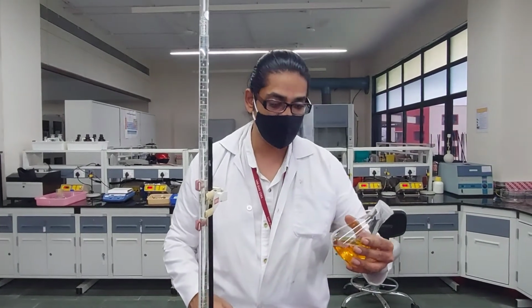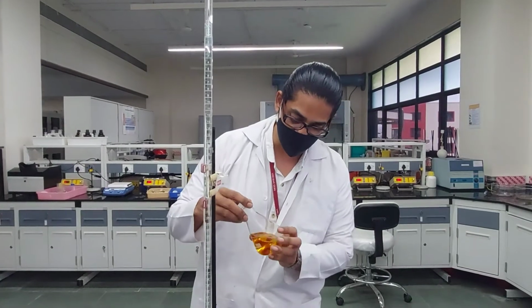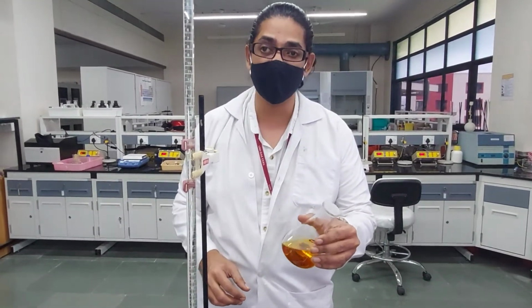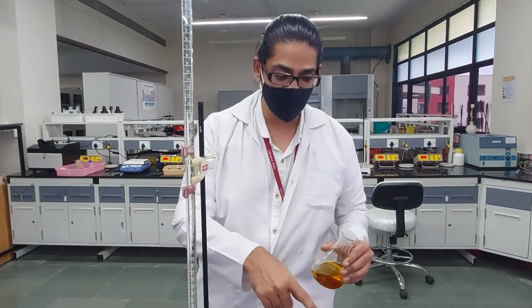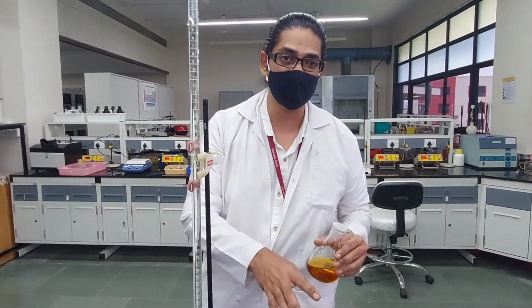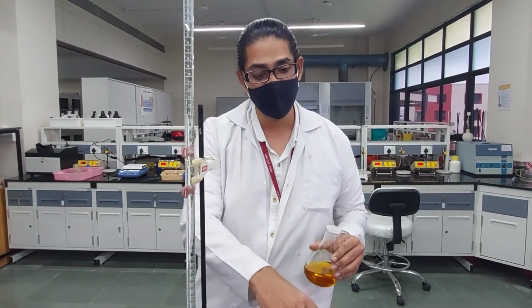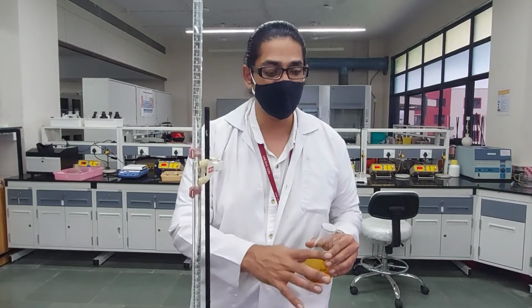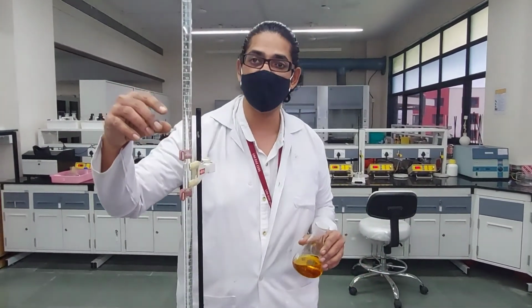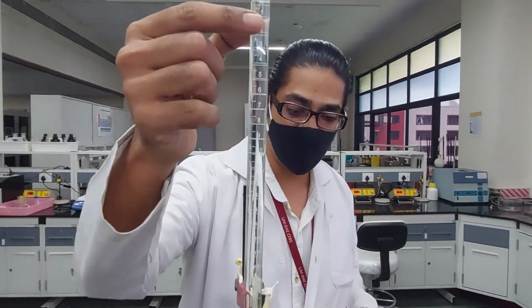So this is the dichromate solution. That's the blank one. Is that the right one? Yes, that's the blank one. It doesn't have any soil, so that will be our control. When we put in the soil, whatever soil is oxidized, we will back titrate and see how much dichromate is remaining, because dichromate is a nice strong oxidizing agent. For the titration, we are titrating it against ferrous sulfate.